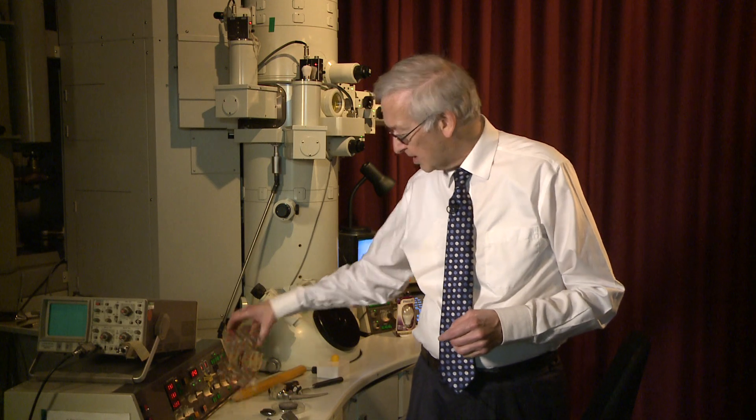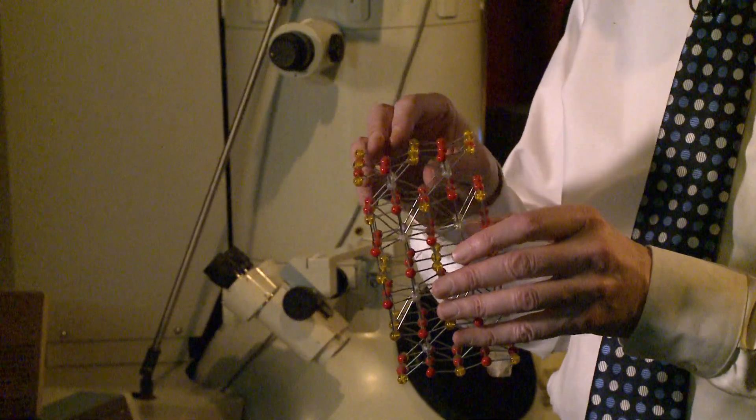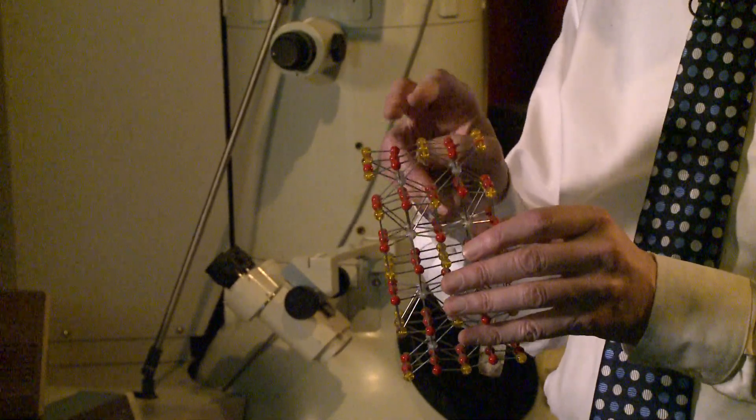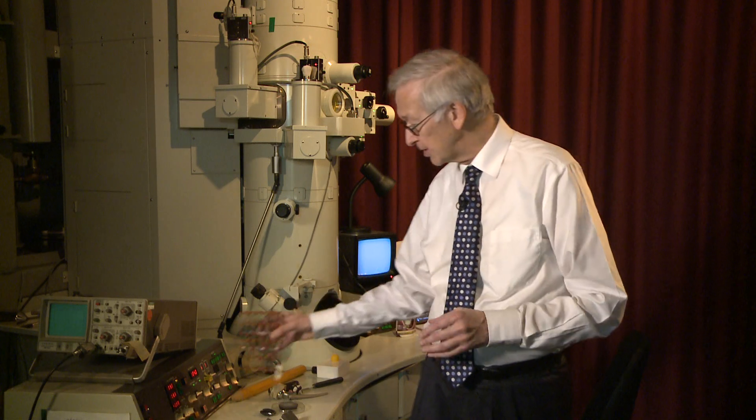With an electron microscope, you can magnify 10 million times, so you can actually see the atoms in a material, and you can see right through the material — the electrons penetrate right through, so you can image the interior. For example, this is an atomic model of a high-temperature superconductor, and in an electron microscope you can see all these atoms, analyse what they are, see the interior, and see defects inside the material.